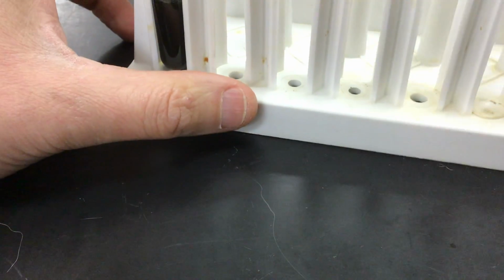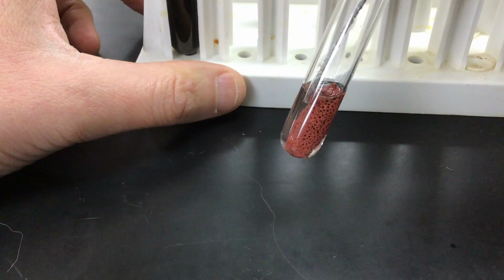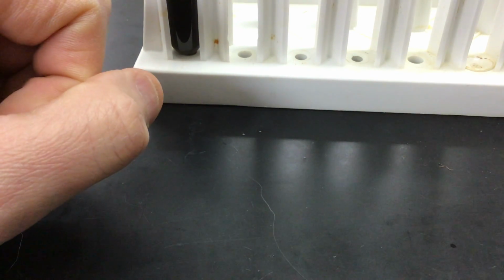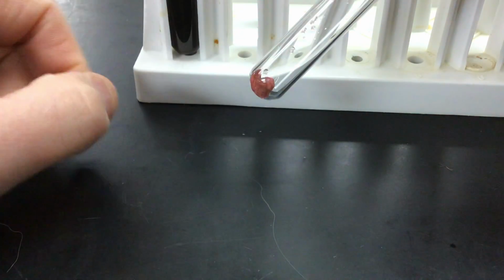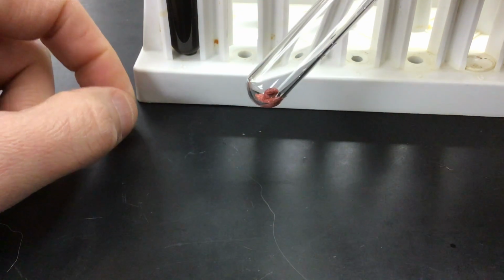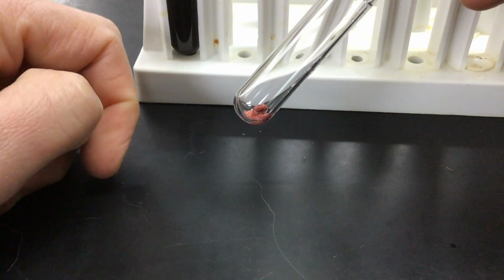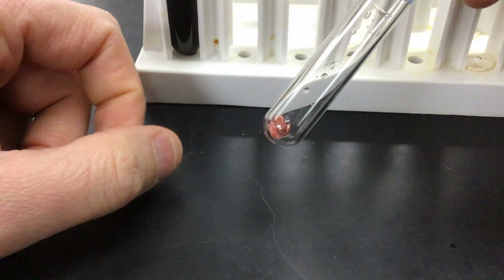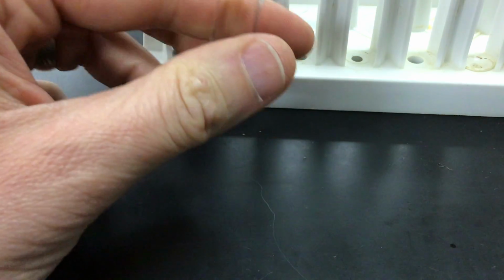Now, what I'm going to have students do the last day of class is pull some of that solid out and put that into a test tube. And now you'll notice that this is solid state copper, but it doesn't look anything like the first original type of refined copper. So how can I truly confirm that this substance is indeed copper and not some other red solid? Well, I'm going to come back and we're going to add nitric acid to this test tube.